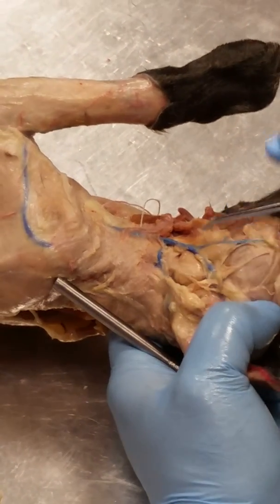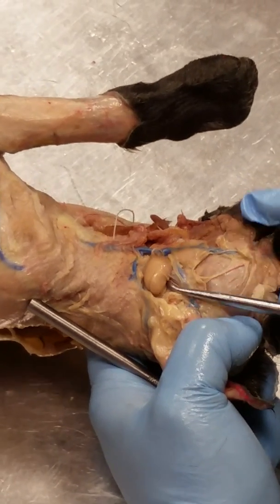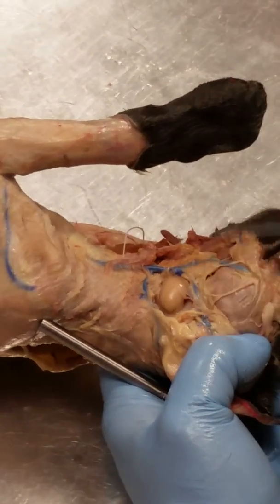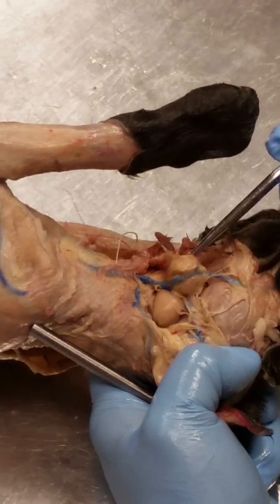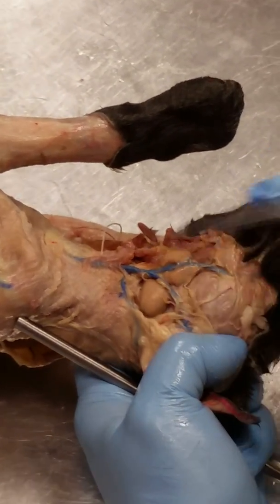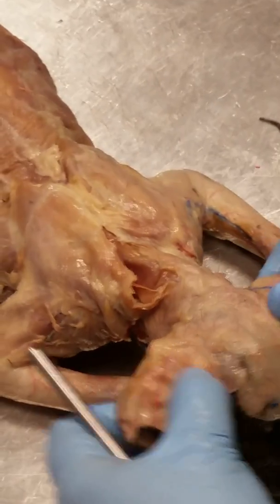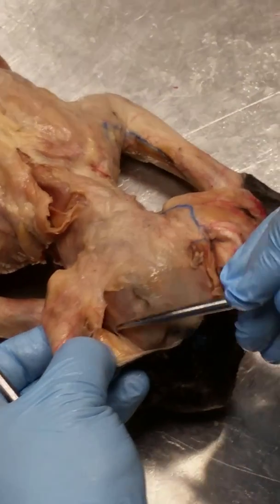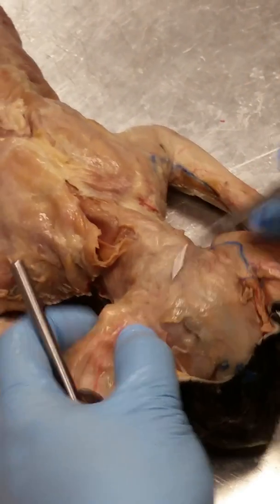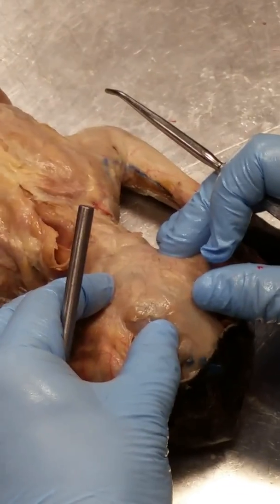Okay, so these sublingual, under the tongue. Look at that. Ooh, it's like that cat just gave birth to this huge salivary gland. Okay, there's another one. I bet I could find some small ones, but we're not going to do that right now, okay? So, here are the ears of the cat, and we have all of this muscle in and around here. Temporalis, okay?